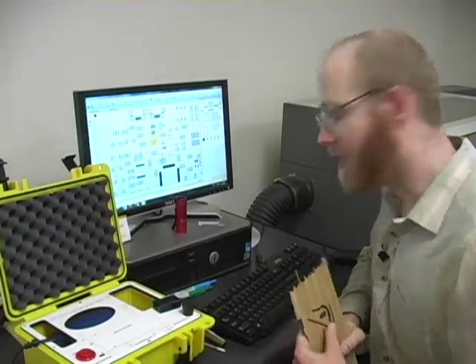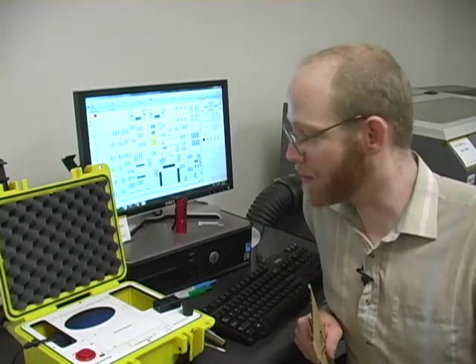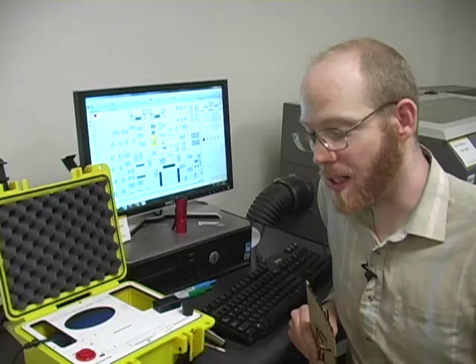This laser cutter is not vented externally. Below the cutter itself is a filter system. So I'm interested to see what the levels look like, and I thought I'd walk through the testing procedure.